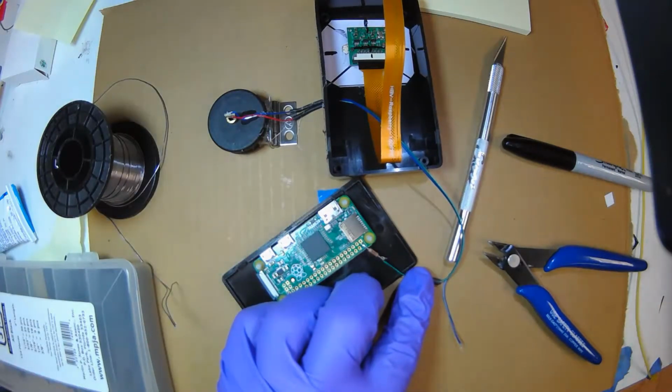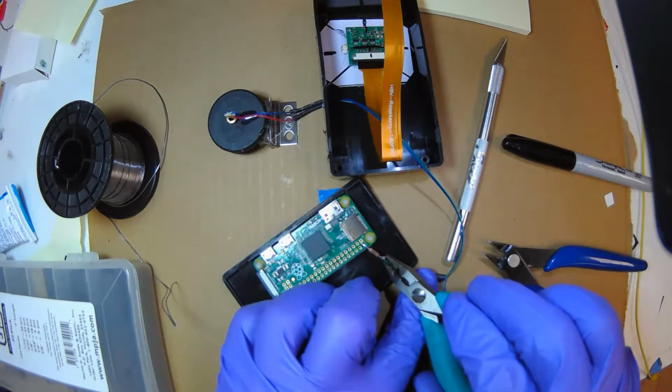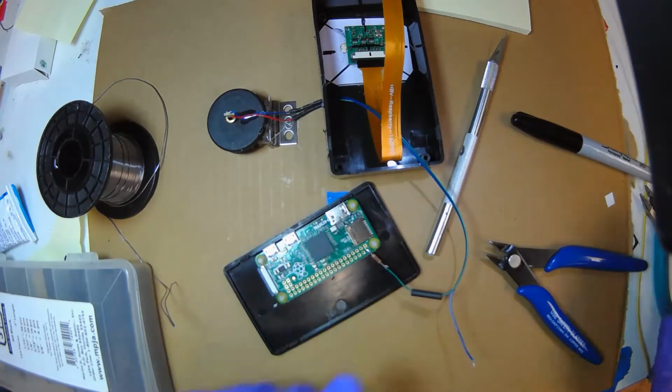And to make it a little more secure, I'm going to use my tweezers. If I can find my tweezers. Well, I'll use these round nose pliers. And I'm just going to squeeze my loops. That'll help hold it while I solder it.